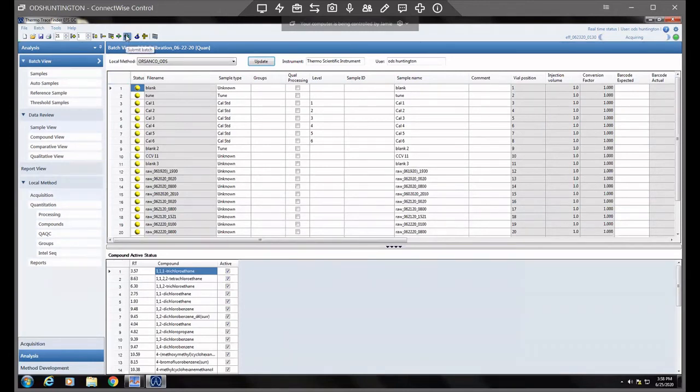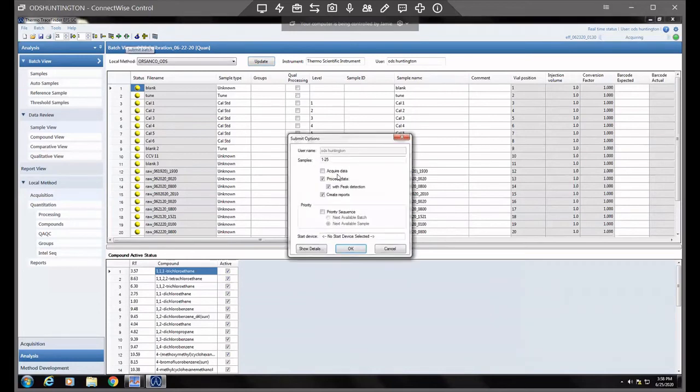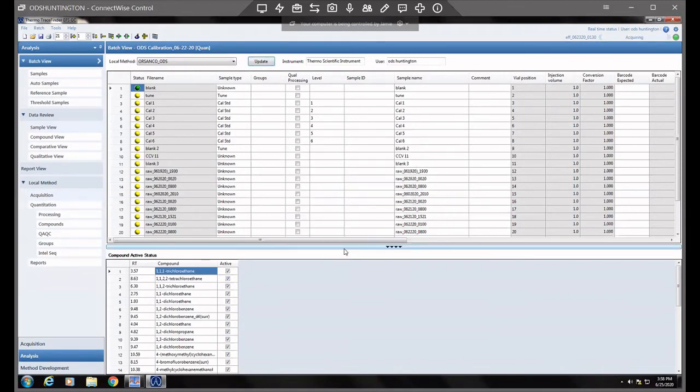If you click submit batch, this acquire data option is not selected. We're just processing the data with the new terms of the method. So you want to make sure this is not selected, and it should default to not, because it knows. But if you click acquire, it's going to think you want to run whole new samples. But we'll just click okay. So for samples 1 through 25 in this particular run, it will update all of those times for the hexachlorobutadiene. It might take a second, and you'll see as it scrolls through each one as it updates. So we'll wait till they're all finished.